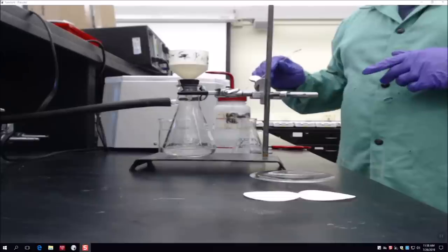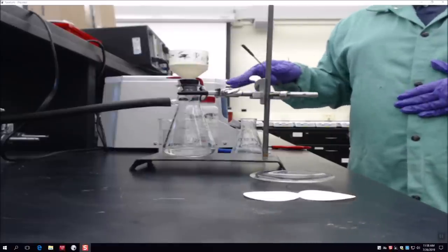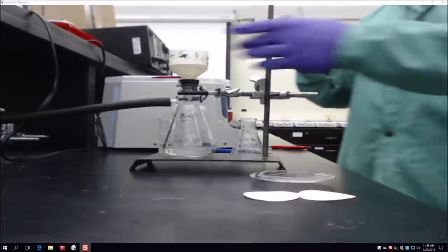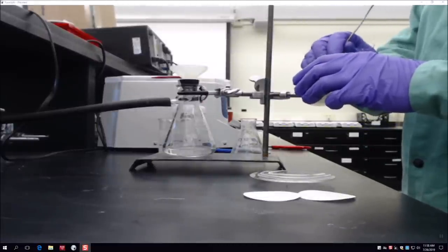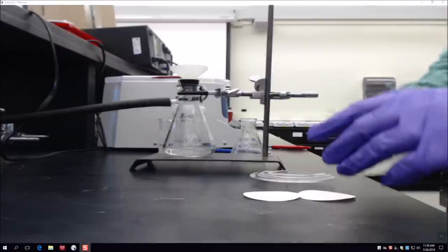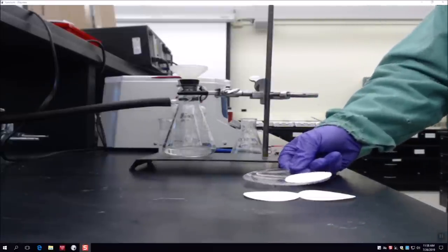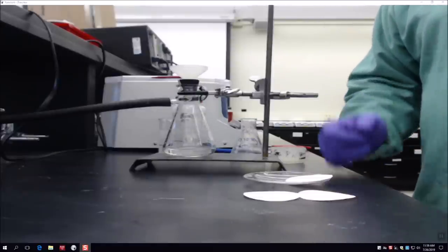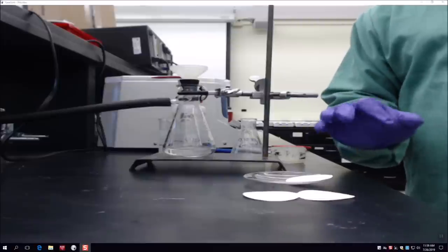Important: acetone is a flammable substance, so keep it away from any open flames, still-hot hot plates, or the heat lamp — keep it isolated so you don't accidentally start a fire. Once done, take the top of the Buchner funnel off, use a spatula to dig at the side of the filter paper, pick it up, and place it on the watch glass. Then take the watch glass to the heat lamp to dry. You'll have three filter papers — dry all three simultaneously, having weighed each beforehand and labeled the watch glass positions.